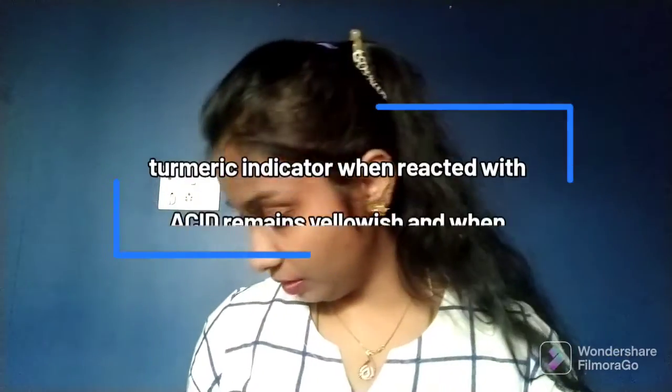And the drinking soda which I took is also an acid because it doesn't change its color. And what else can I take? I can take citrus fruits, right? Citrus, lemon as well as orange. They come under the acid because they don't change the color of the turmeric indicator.